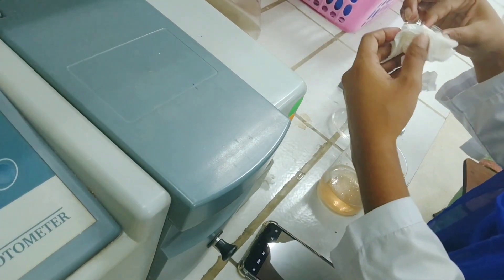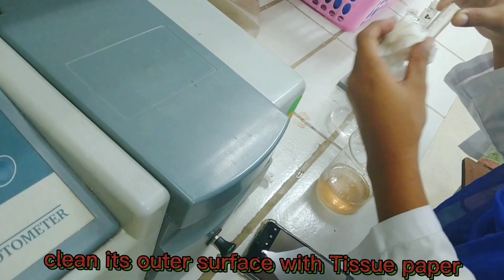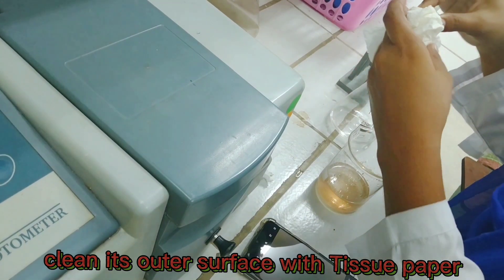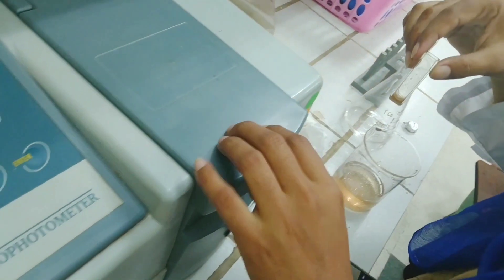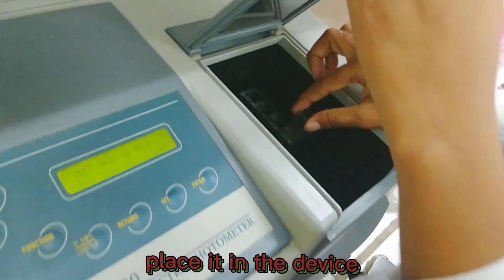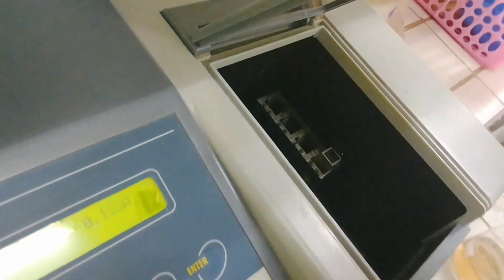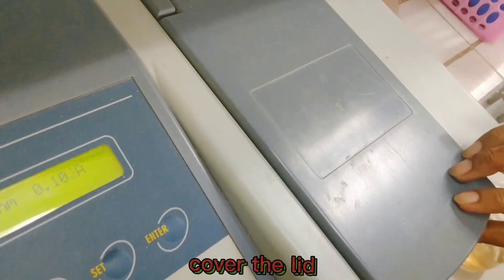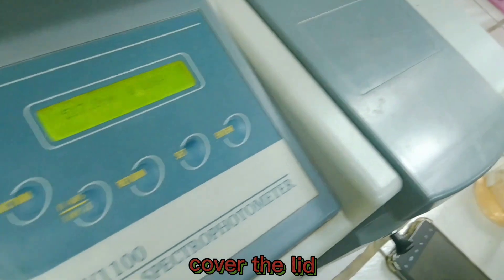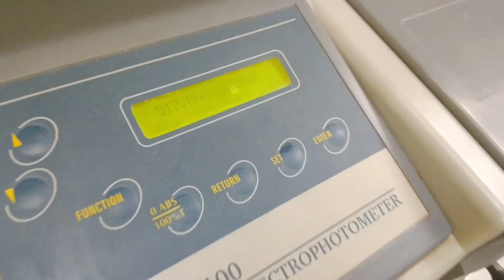Clean the outer surface of the cuvette with tissue paper. Place it in the drawer. Don't forget to cover it with a lid.